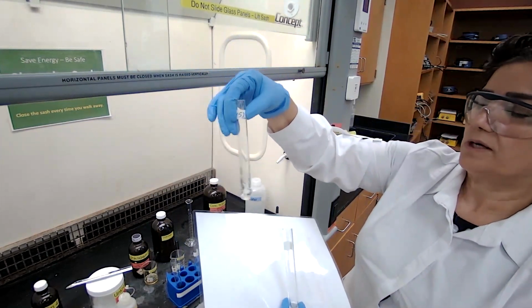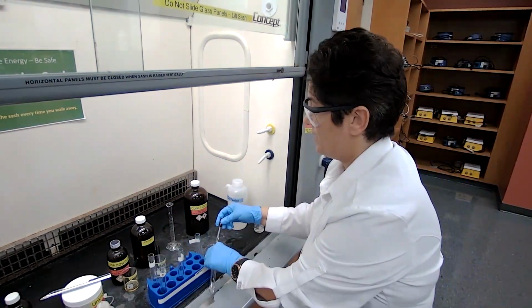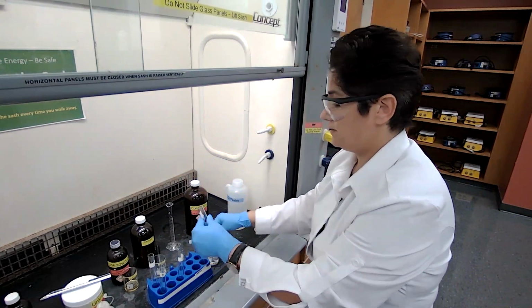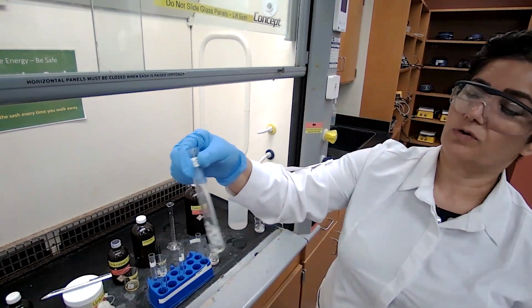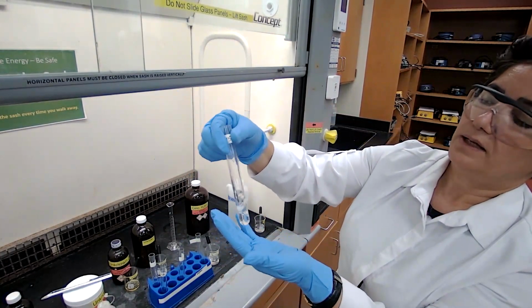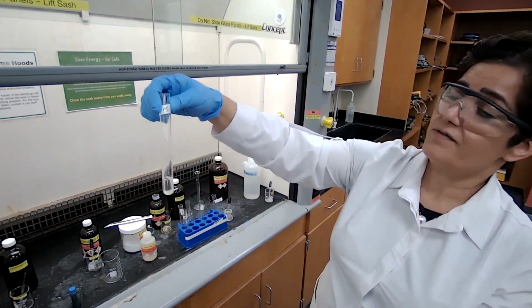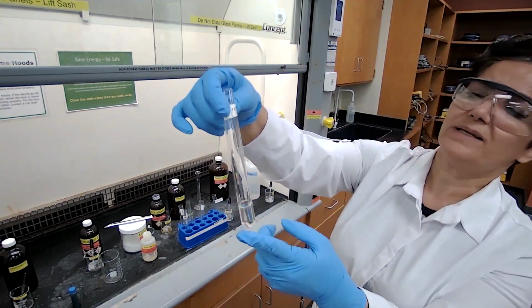I'm going to give it some time to make sure. I'm going to add a little bit more of the sulfuric acid. If either the solid disappears or if there is a color change that we could all see, then we record it as a reaction. We're checking the unknown 5 one more time in H2SO4 after sitting for like 2 minutes.